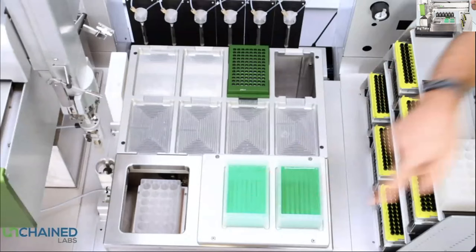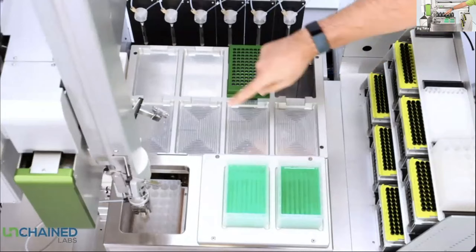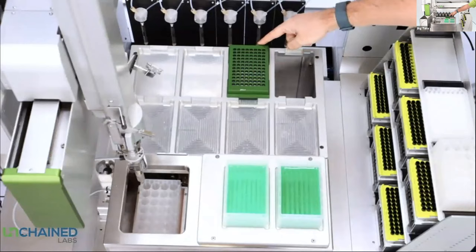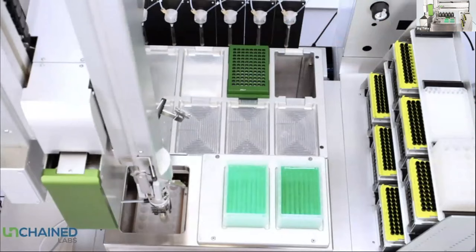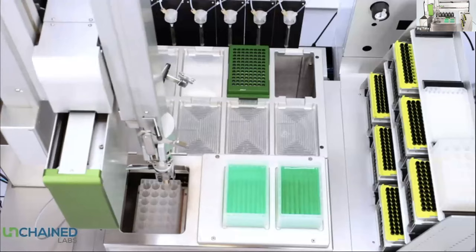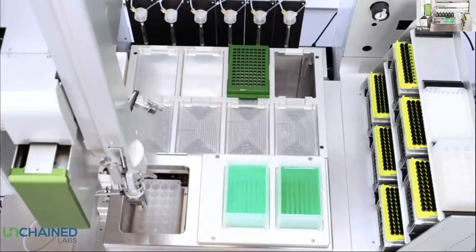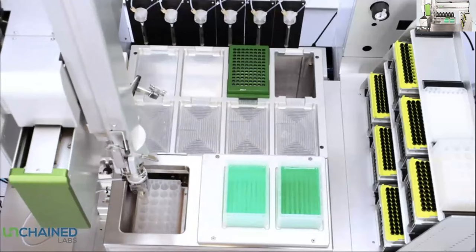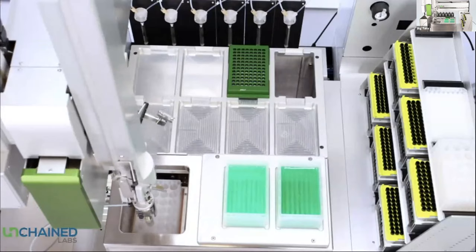What you can see first is the buffer exchange chamber door. Your unfilter goes in that chamber and stays there for the entire run, starting filled with protein. On the deck you have up to eight positions for buffers, a green position to store tips during a run, and a position for a tip rack. The first step of the process is to measure the volume — this sensor picked up by the gripper analyzes the volume remaining in each well using a non-contact acoustic method, sending a small pulse of acoustic energy into each well and listening for the reflection to extrapolate the volume.